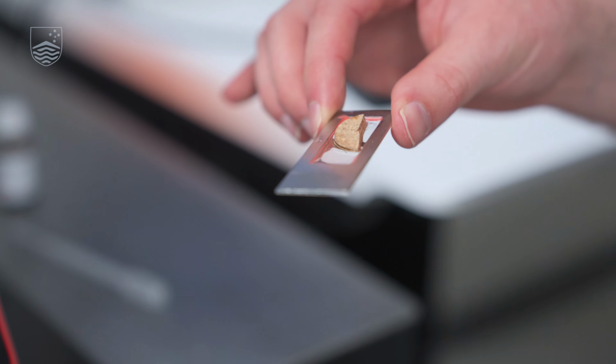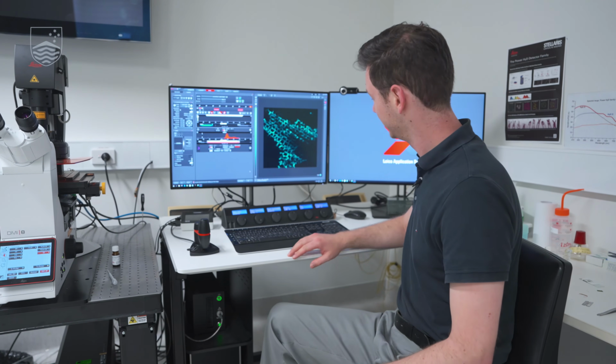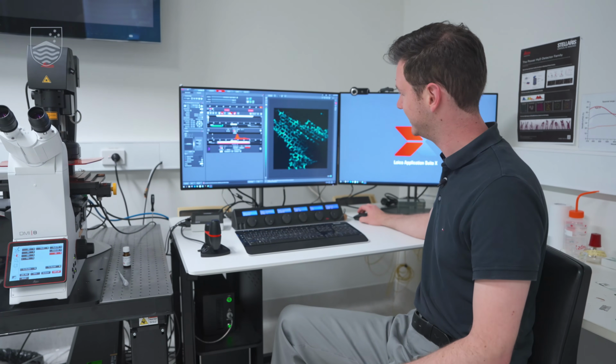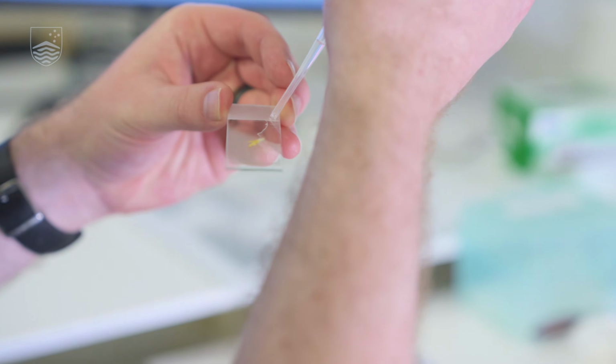Okay, our next specimen is a piece of cork. Now, cork has a special history in microscopy because the word cell was first used to describe what a microscopist saw when looking at a piece of cork. So here we have it, cork under the microscope. So what you're seeing are individual plant cells in what looks like a honeycomb pattern. In this case, the cells are dead and we're just looking at the cell wall. And the contrast that we're seeing comes from naturally occurring fluorescence.